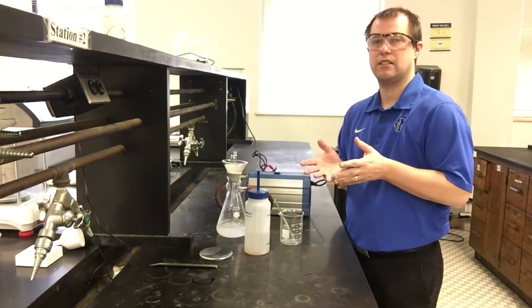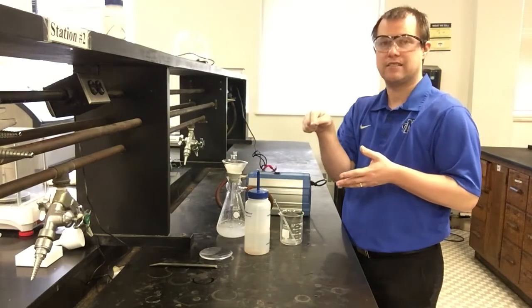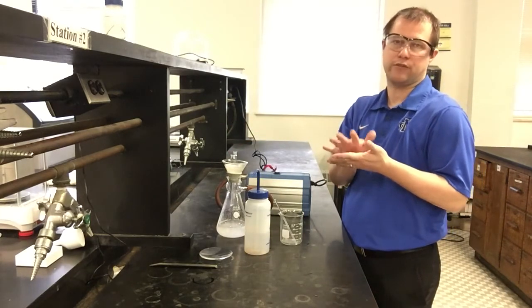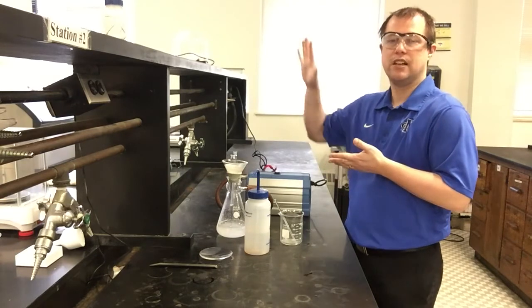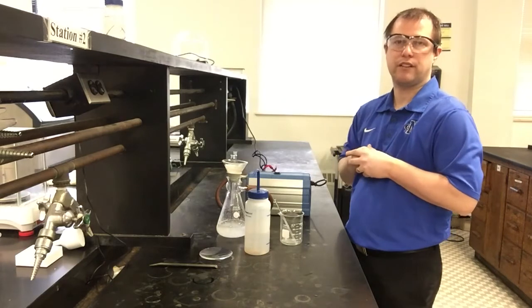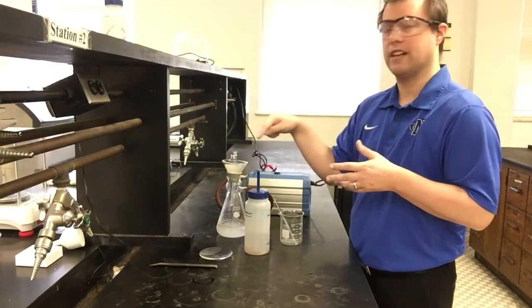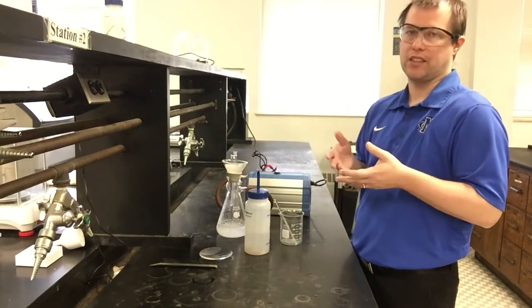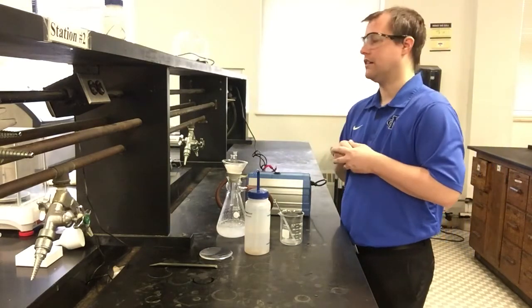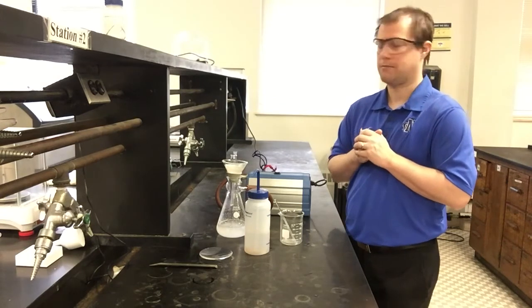As soon as we get this part done, the last part is basically to take the filter paper out and put it on a watch glass. The reason is that it's easier for us to dry it, because we're going to take that watch glass and put it in an oven. That way we can dry our sample for about 10 to 15 minutes, so any water that's left, both on the filter paper and in our sample itself, we can hopefully get removed. Then we can come back and take a final mass of our hopefully mostly dry product.